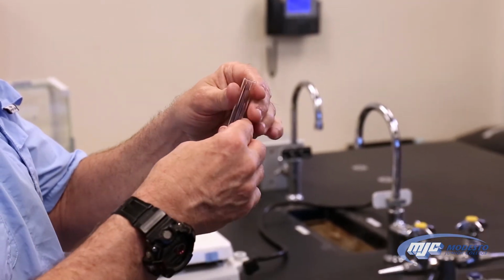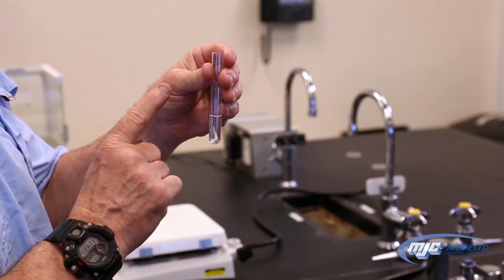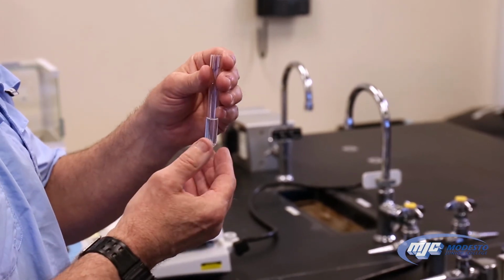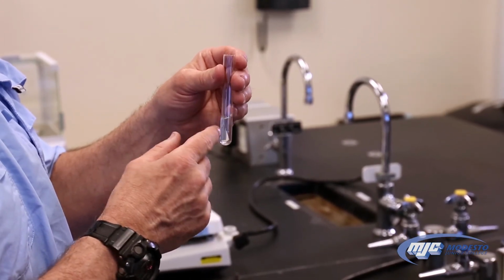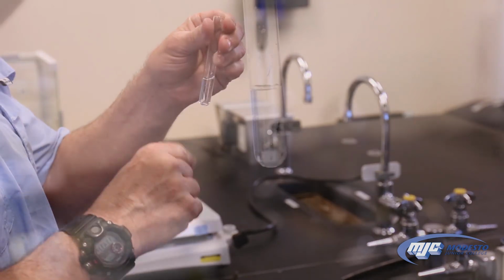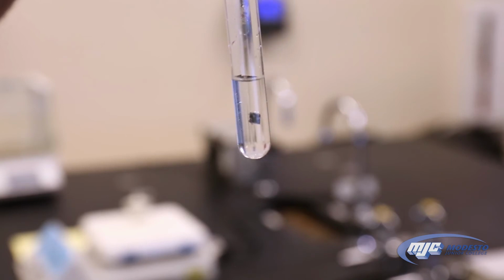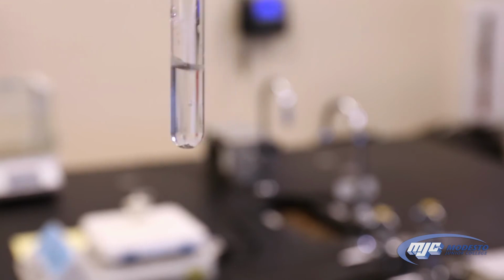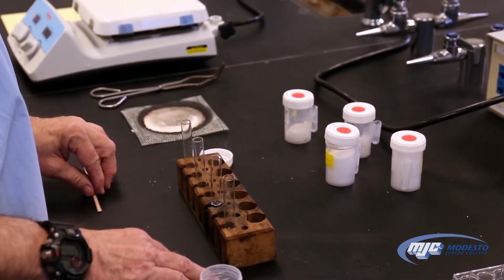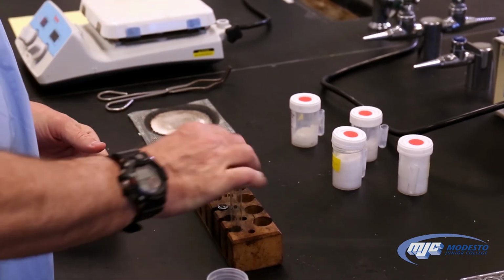And then we're going to let it sit a few minutes, and we'll come back and look at that, and you'll see what happens if you have zinc sulfate. Remember, if you have zinc sulfate, you're going to get a black coating on what was a shiny piece of magnesium metal. Actually, you can probably see it starting to form already. Now I'll show you what it looks like if you don't have zinc sulfate and you have magnesium, because that would mean you have magnesium sulfate.